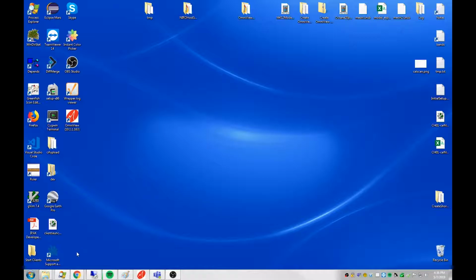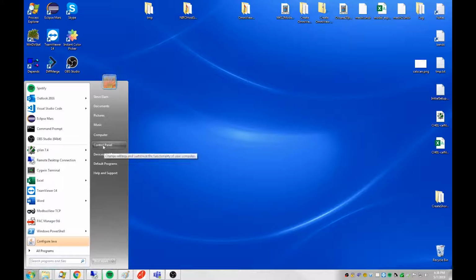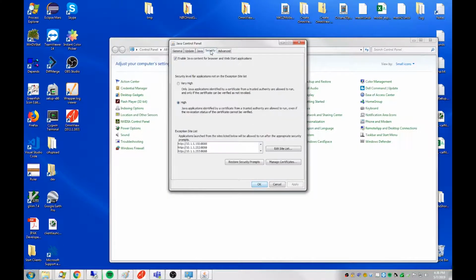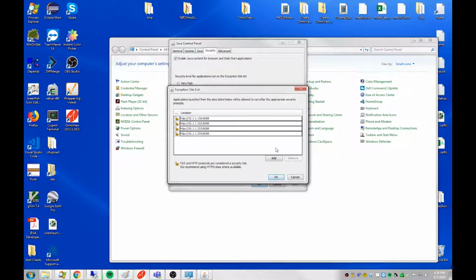So close that window. What you have to do is run the Java configuration program, which can be found a couple different ways. I think it's on the control panel. I think it shows up there under Java. When you bring that up, go to the Security tab. And what we need to do, make sure that this is set to high, not very high. Also, we need to add an entry into the exceptions site list here. So to do that, click Edit Site List.